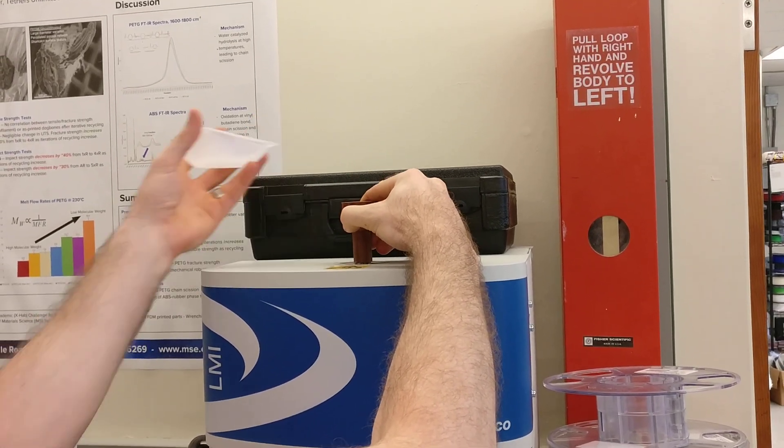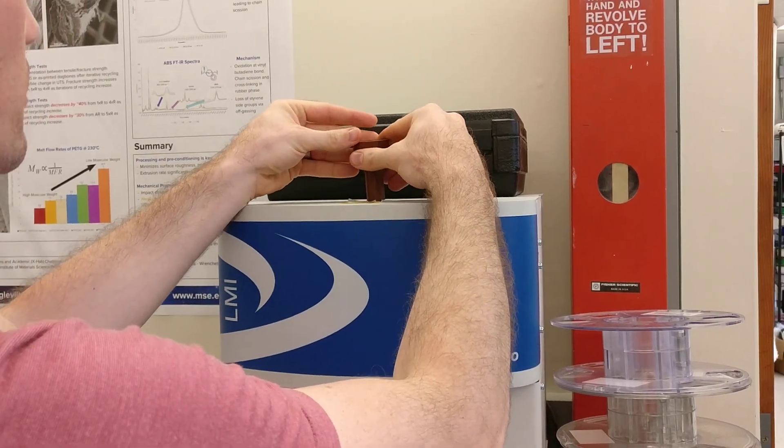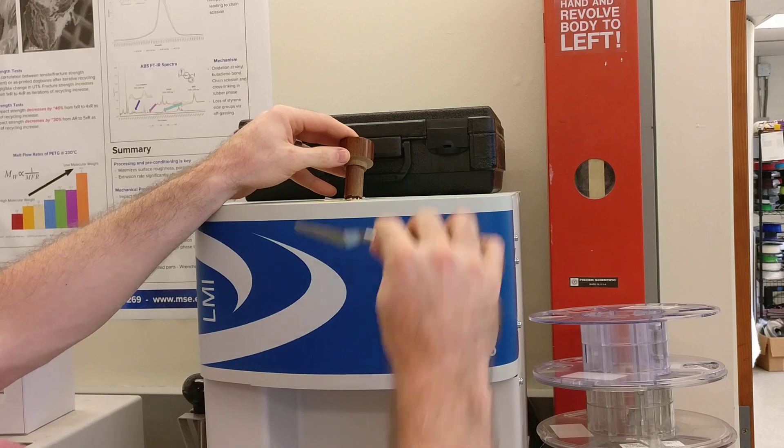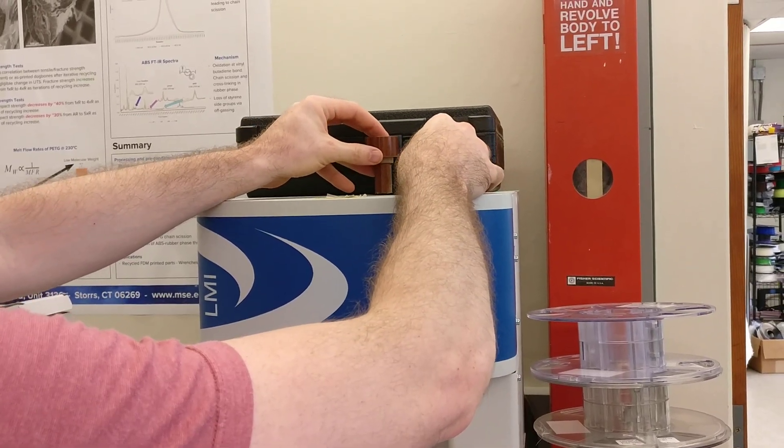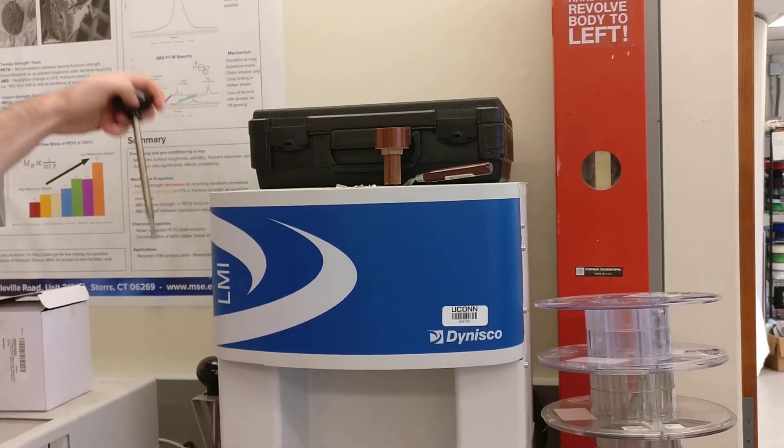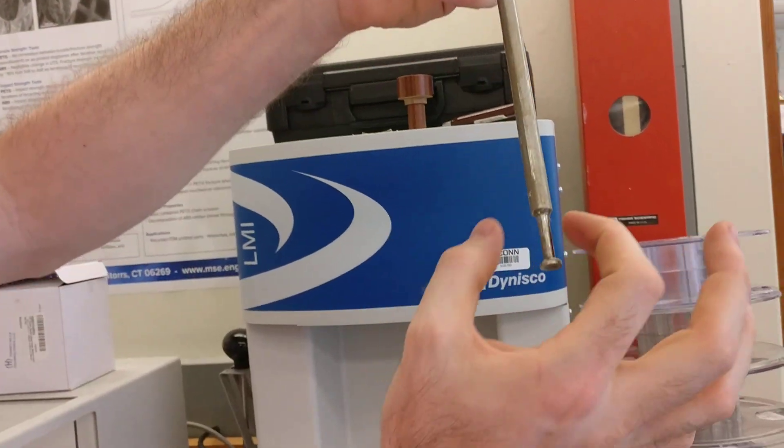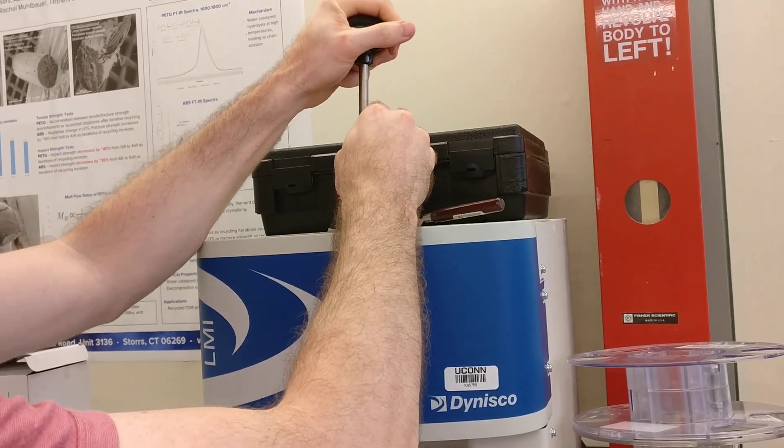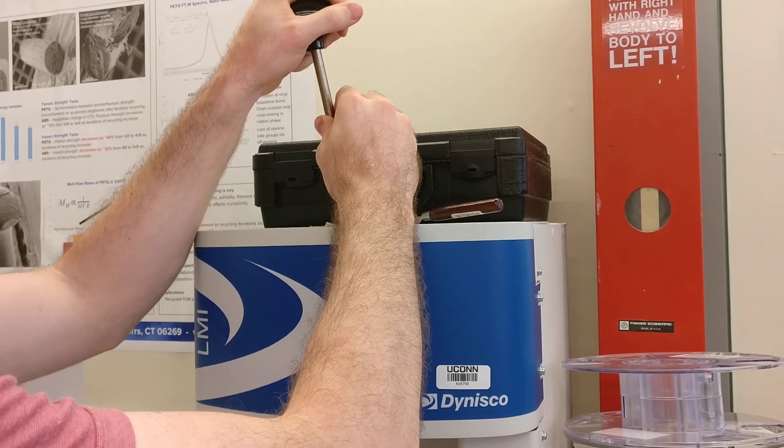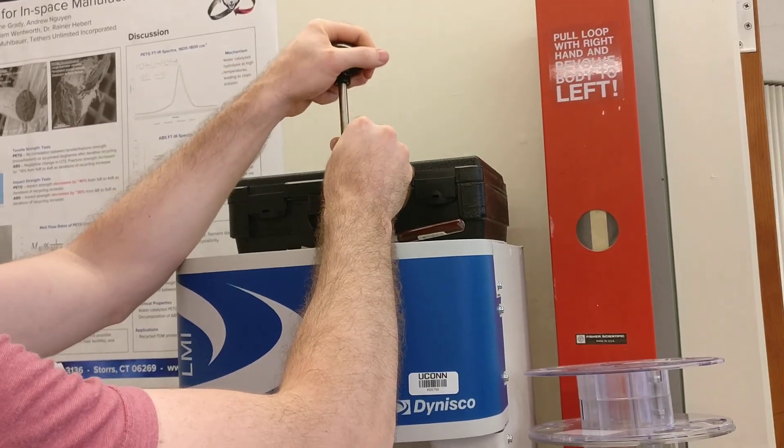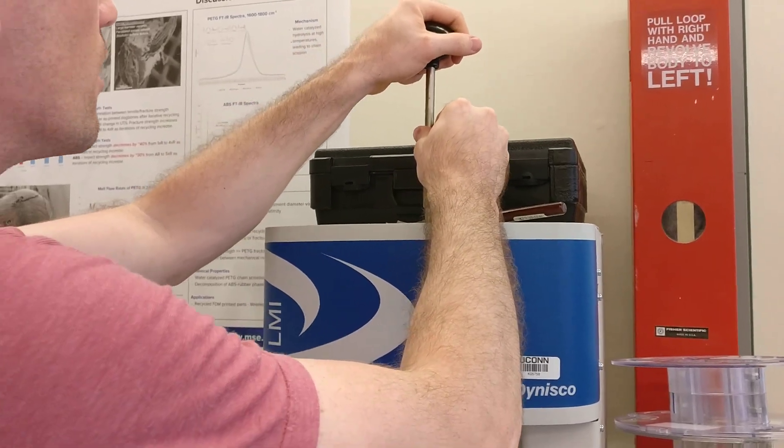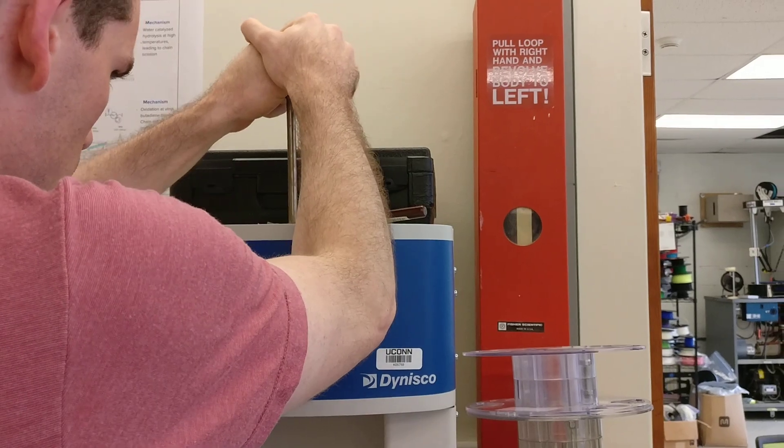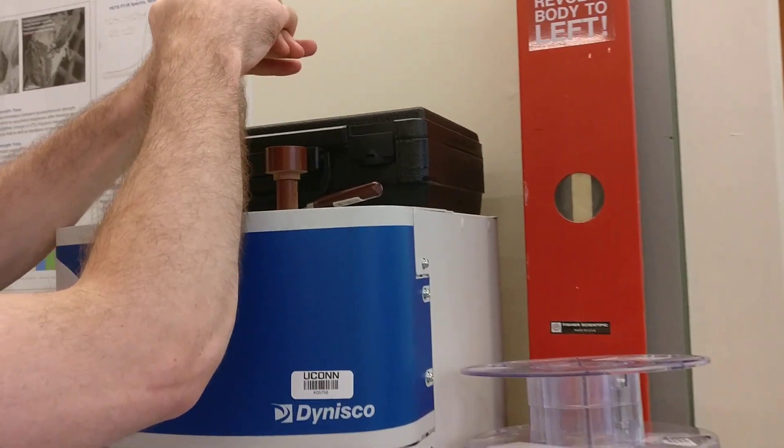In this case, they are not. So we may need to pack these in. We've got a packing tool here. The packing tool has a wider bottom on it, so we're going to push these pellets in. Make sure that this die is straight up and down.